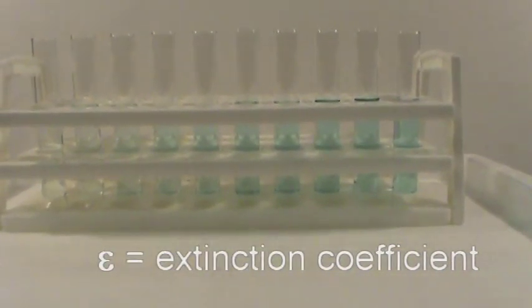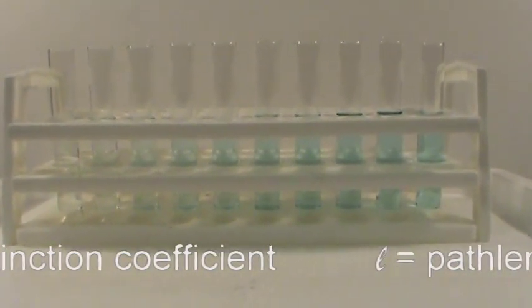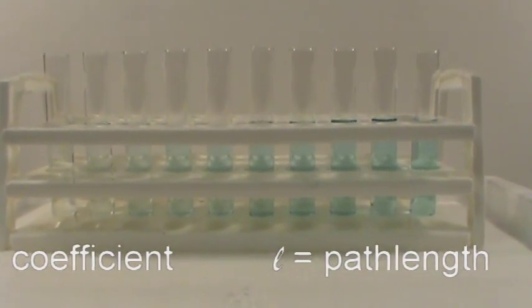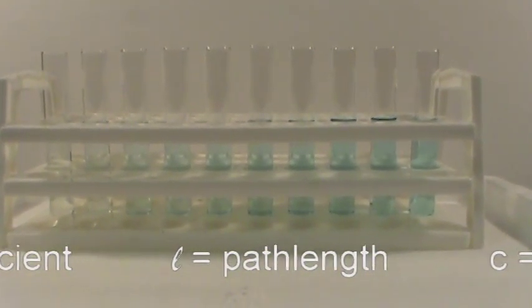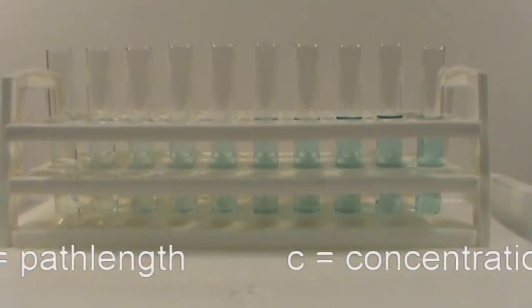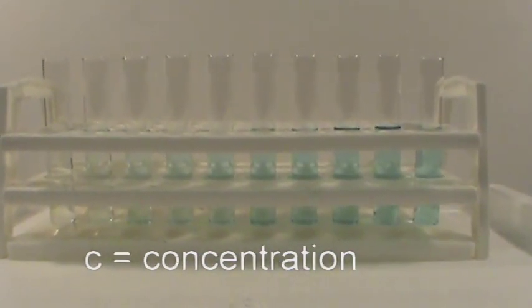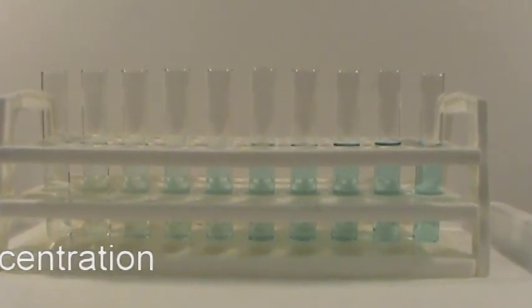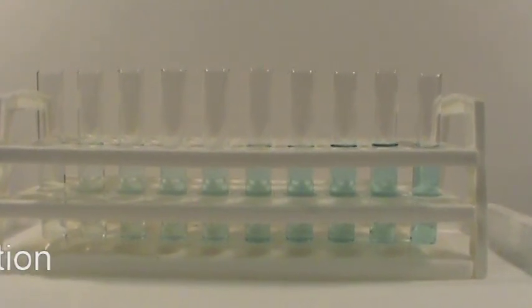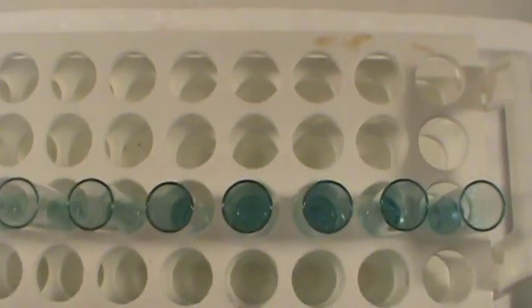Now another thing that we can look at here is, again, even the dark tube isn't all that dark in this case, but these test tubes are only about a centimeter wide, so the path length for them is about a centimeter. What happens if we change that path length? Well, the easiest way to do that in these tubes is, instead of looking at them from the side where we've only got a path length of about 1 centimeter, why don't we look at them from above where our path length is now 3 or 4 centimeters.